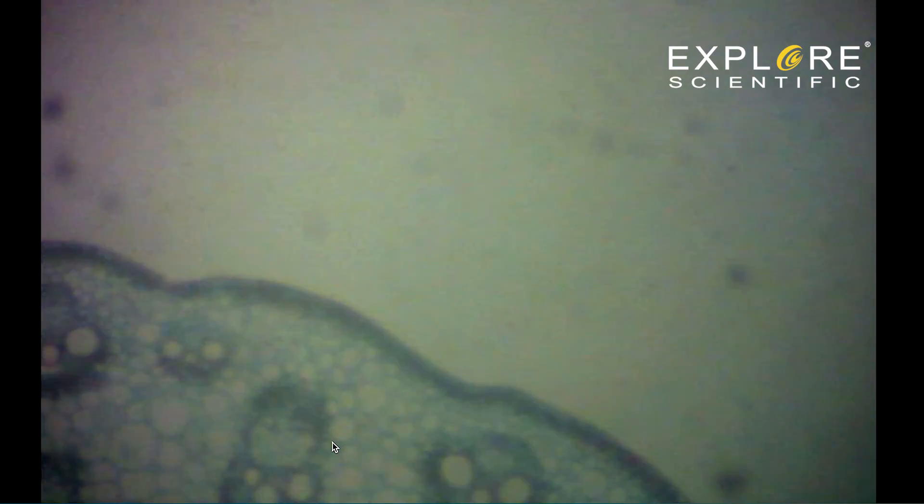When that happens, turn the focus knobs the other way, very slowly, until the specimen is in sharp focus.